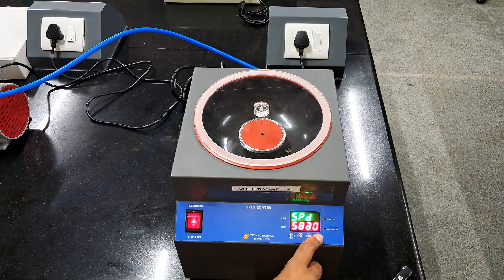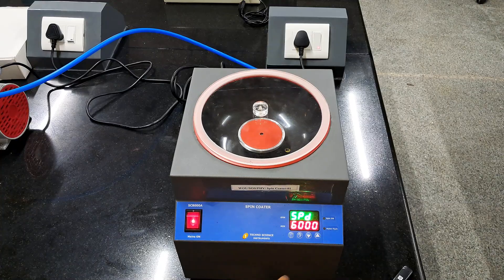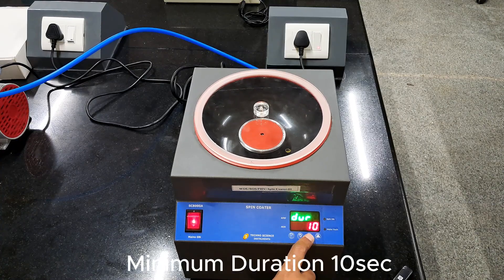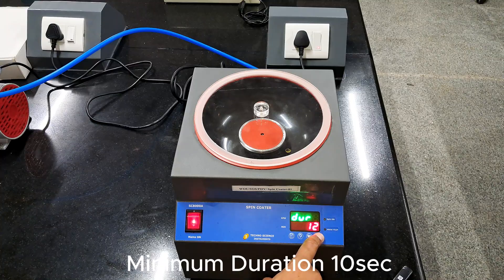We can customize the speed and time. We can program for at least seven segments with different speed and time.